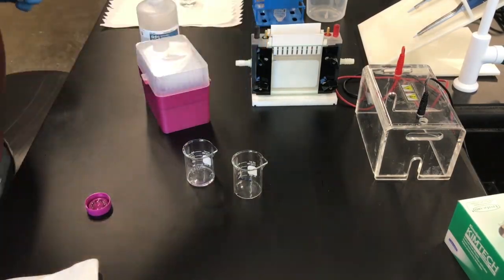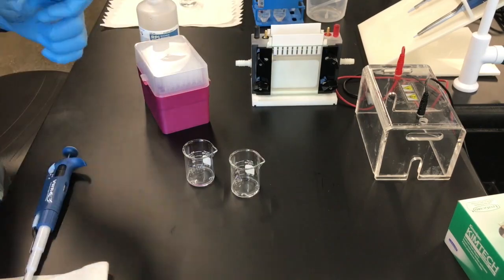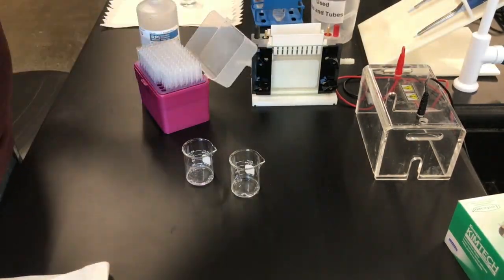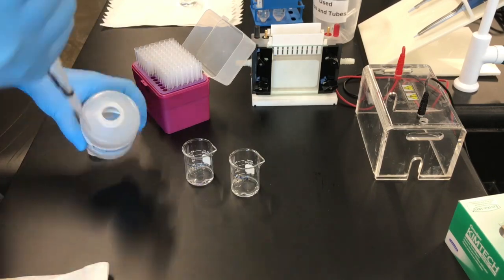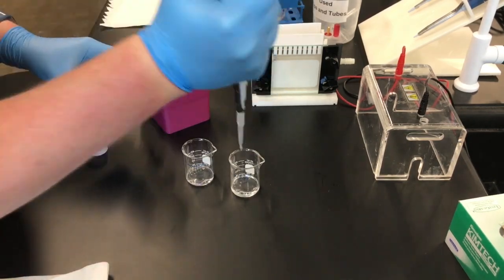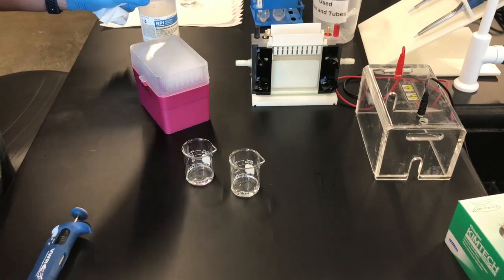While the agarose is solidifying, you can go ahead and prepare your gel solutions by mixing together the 4X buffer, the acrylamide, and the water. Do not add the APS or the TEMED until you are ready to pour the gel.